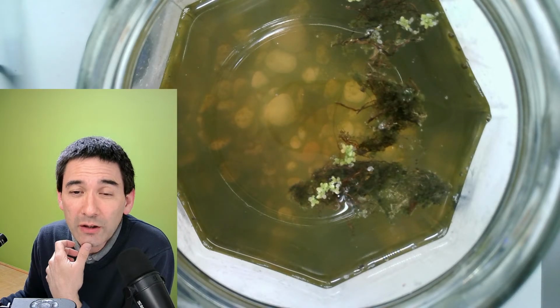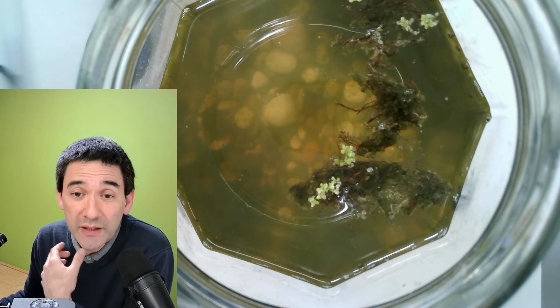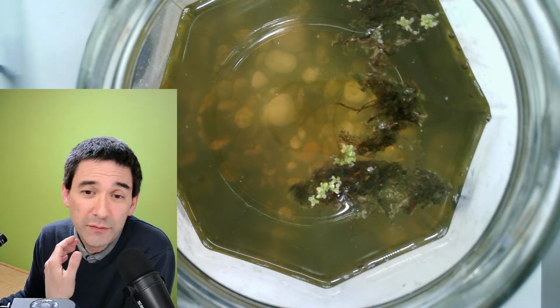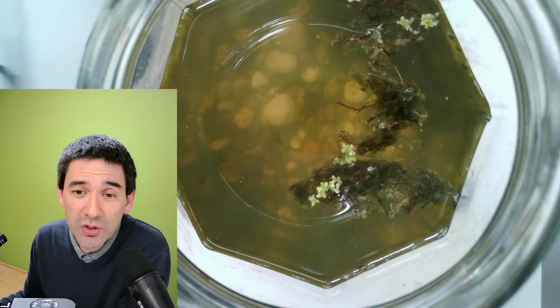An accessible, affordable automatic slide scanner would also be nice to have. They do exist already. But if you want to stitch your own slides together, it's also possible. It just takes a lot of time. So these are motorized systems.